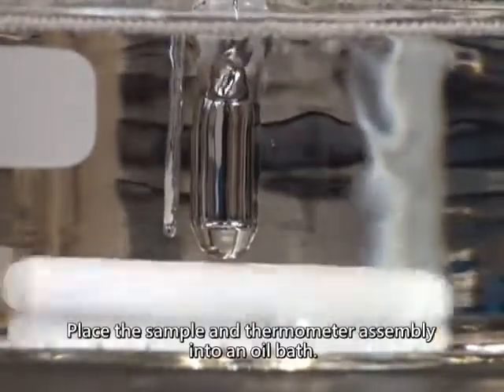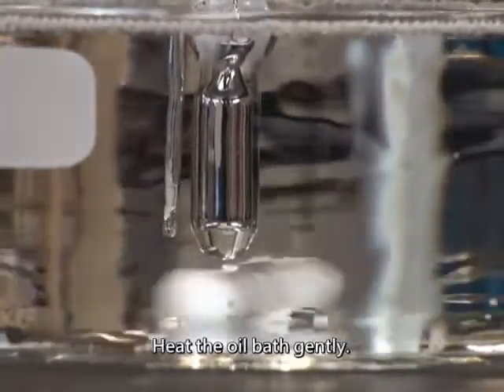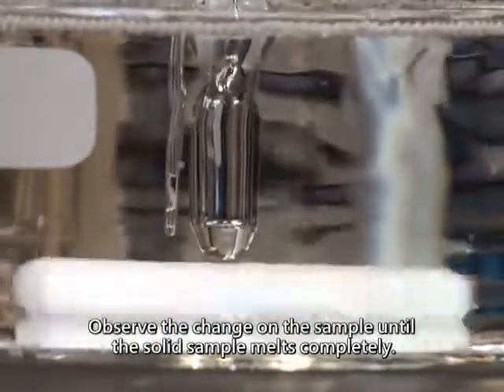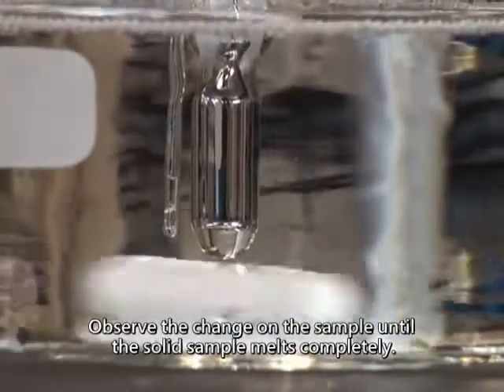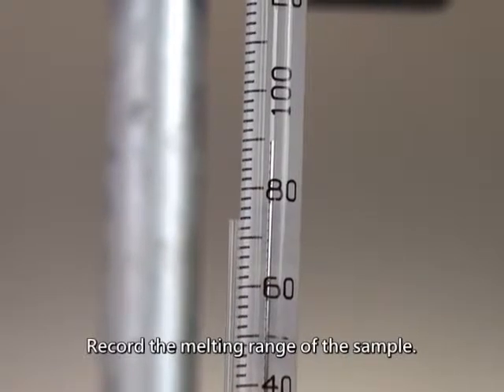Place the sample and thermometer assembly into an oil bath. Heat the oil bath gently. Observe the change on the sample until the solid sample melts completely. Record the melting range of the sample.